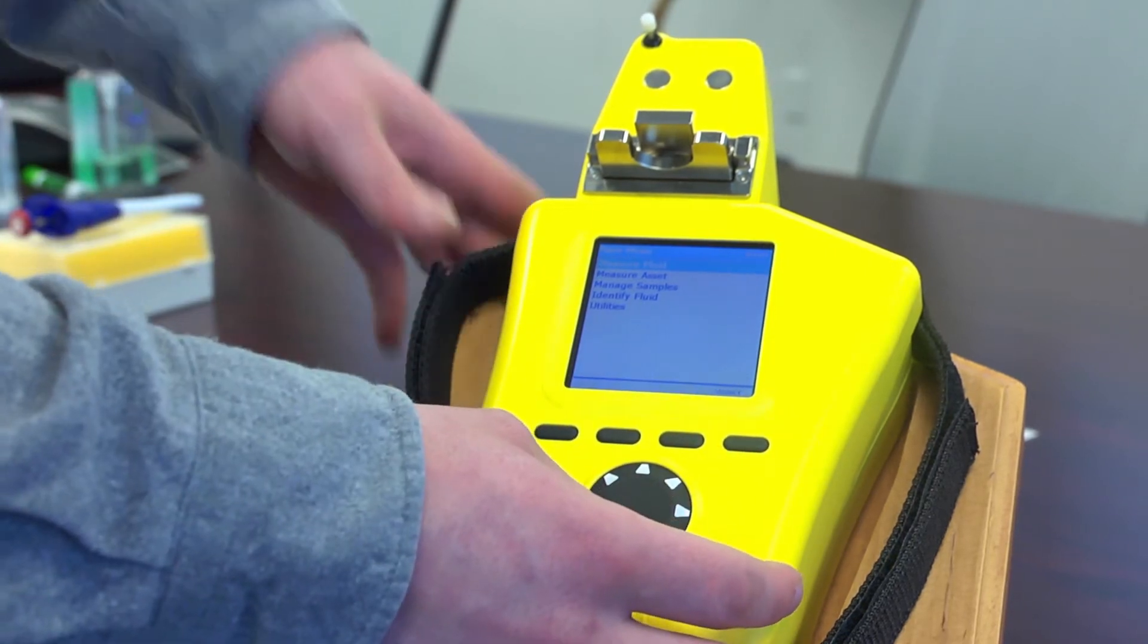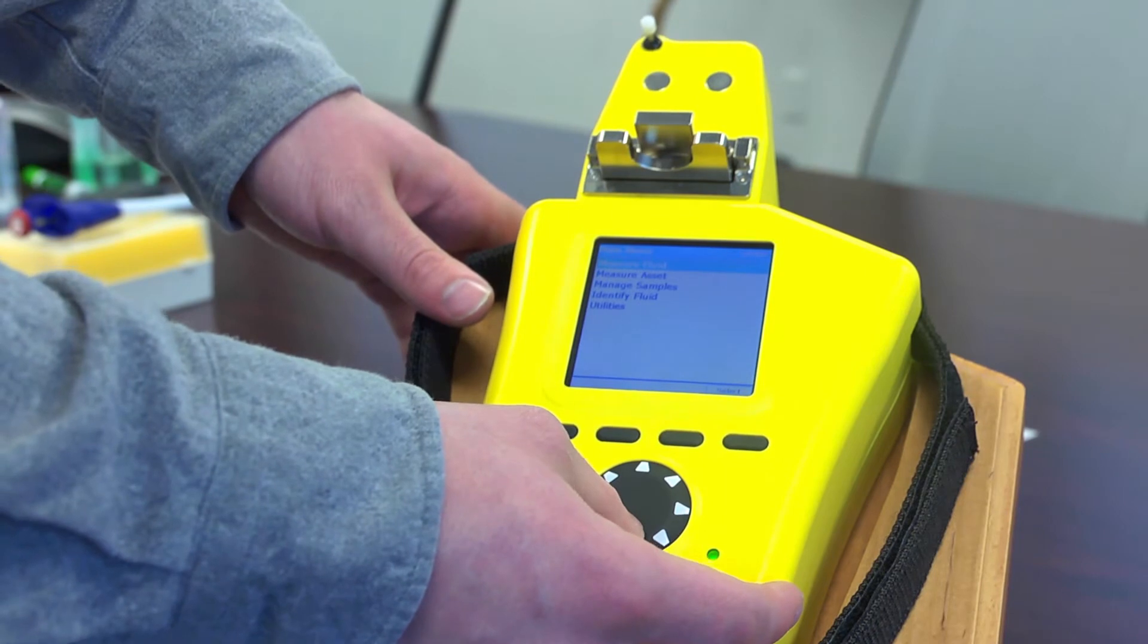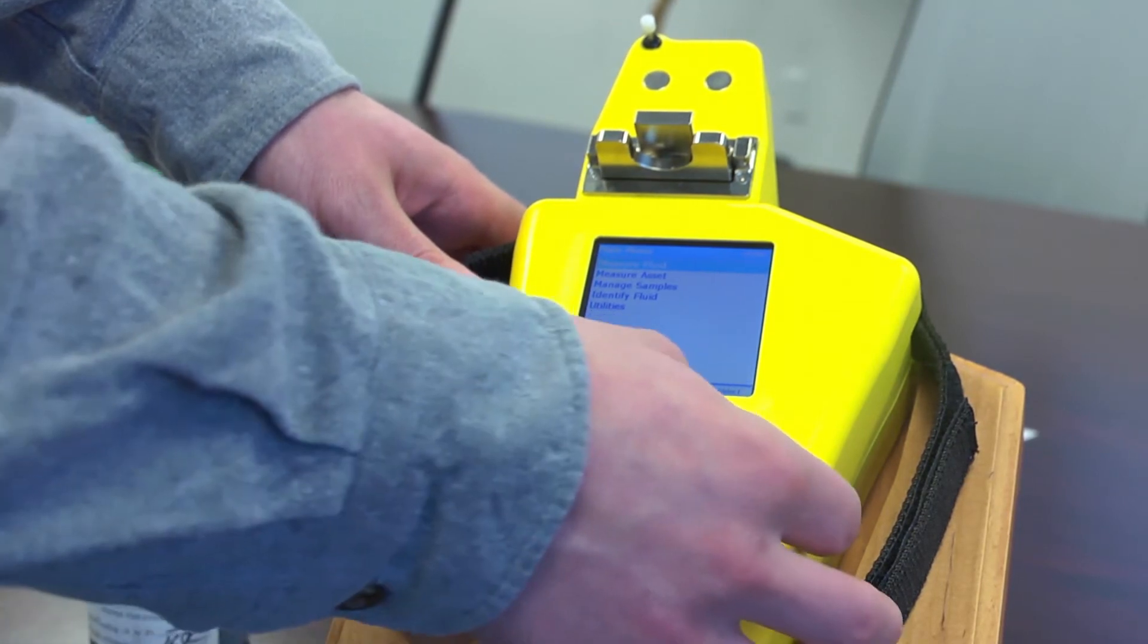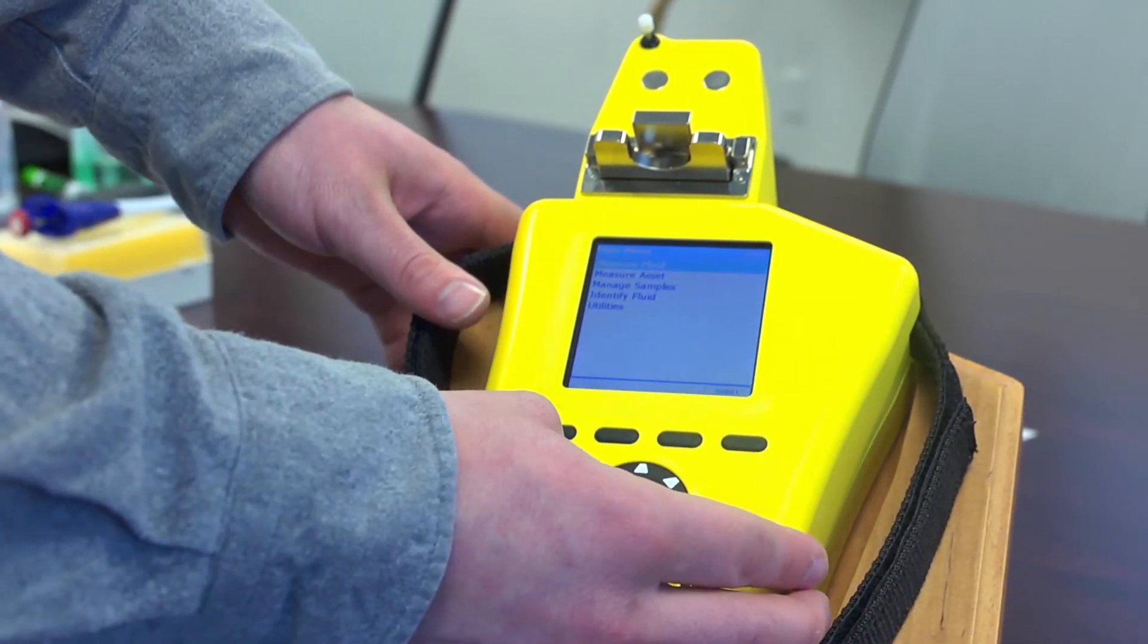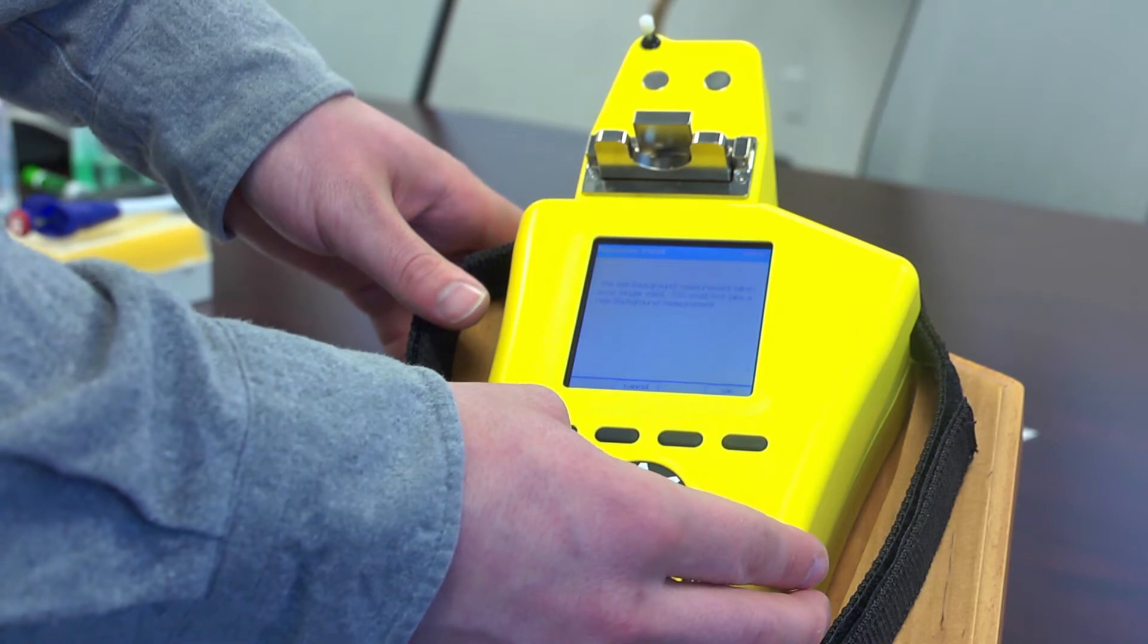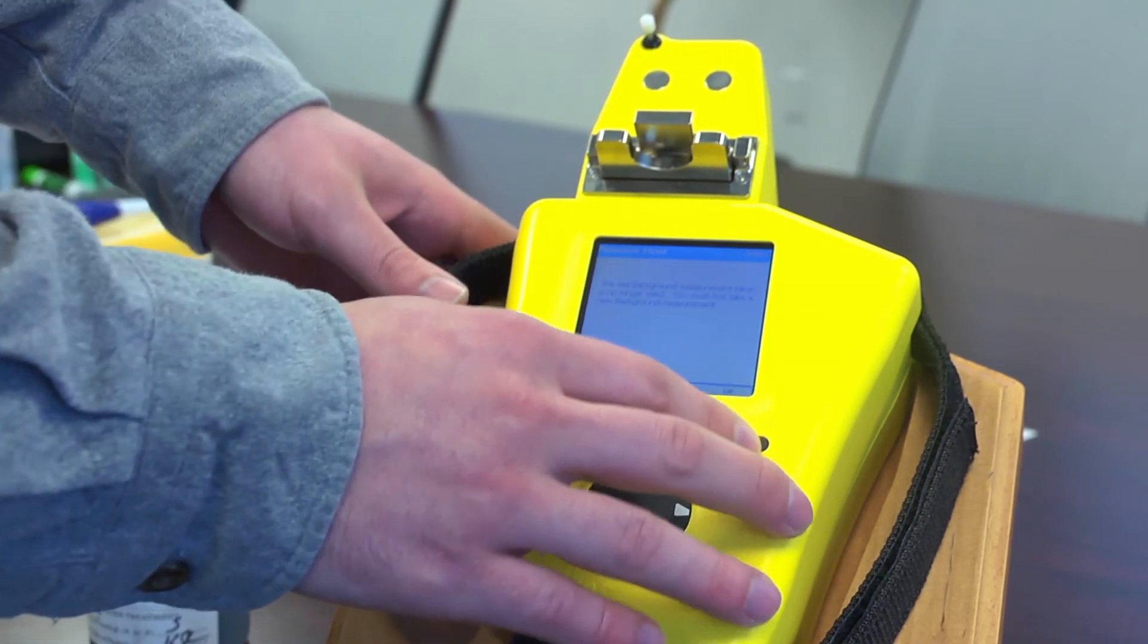To use the actual sample, you start by going to measure fluid and it will then prompt you to take a background.